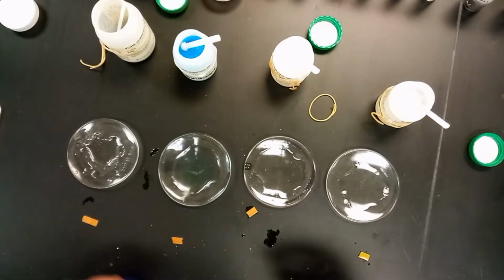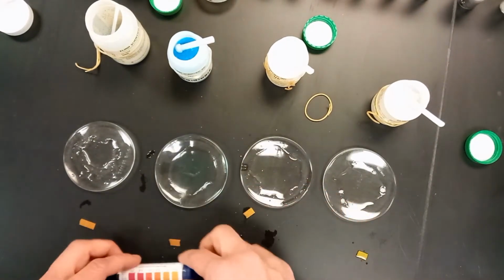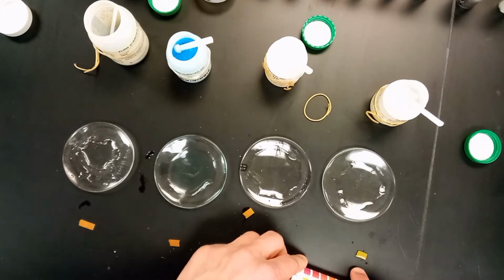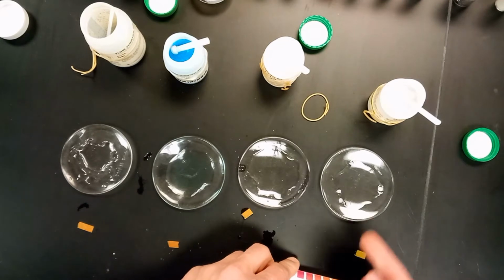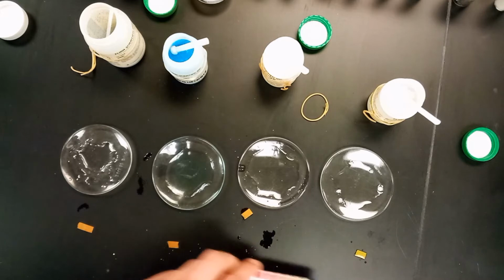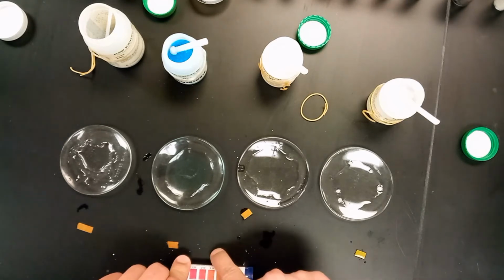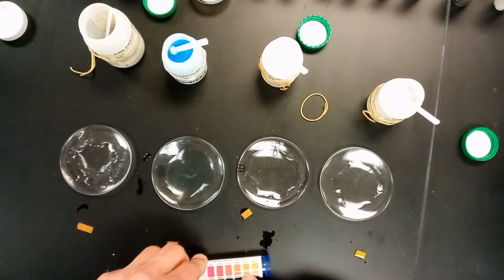When we compare these pH levels to what we see on the chart here, you'll see this one's kind of green, so we'd maybe say this is between a 7 and an 8 over here for paraffin wax, kind of what you'd expect from distilled water. So here, yeah, kind of just what you'd expect from distilled water. Here with the dextrose, this one's kind of orangish. We may maybe say 6 here. For the copper sulfate, it's a little bit darker actually, so you might be able to go 6, maybe 5 even.